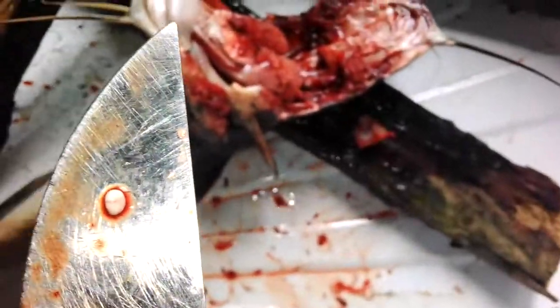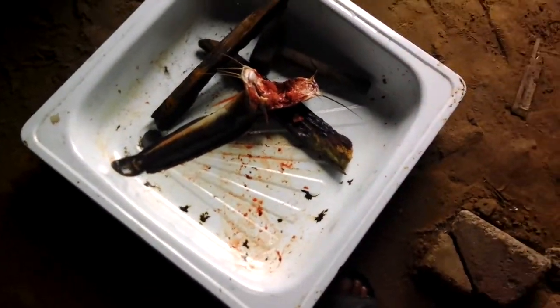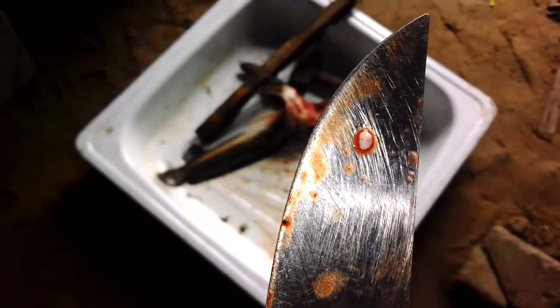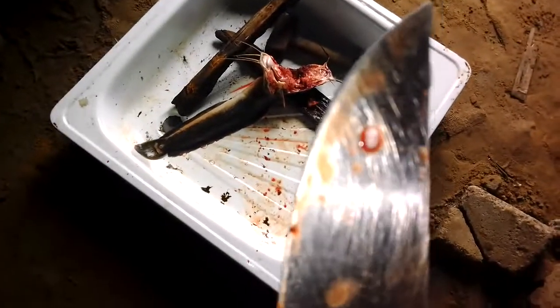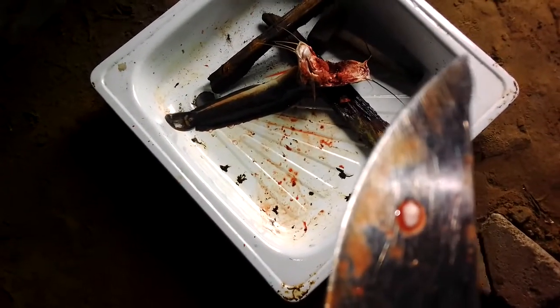This training, this teaching, this video is for my students at Agric Masters Catfish Training School. This video is for you — how to extract the pituitary gland from the head of the fish. This morning I came down; this is a female I have used. When the female shows signs of weakness, I make sure I get the pituitary gland so I won't be spending money on ovulation chemicals sold for seven to eight thousand naira in the market.